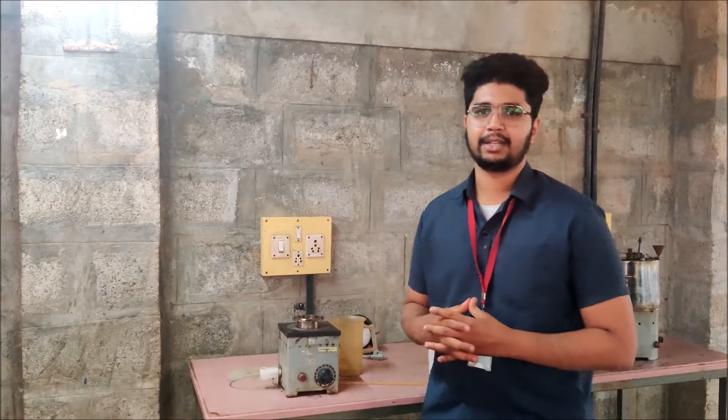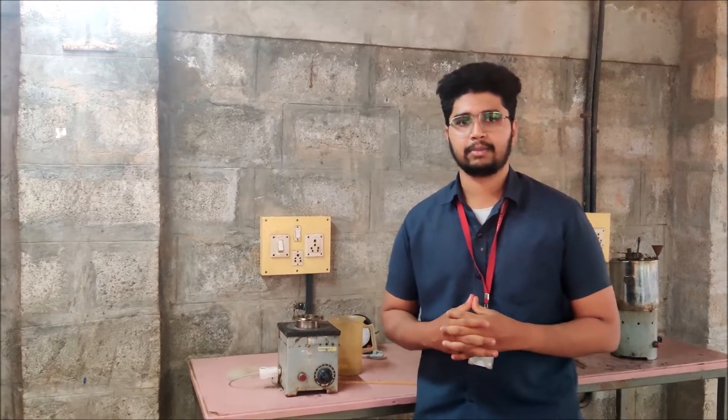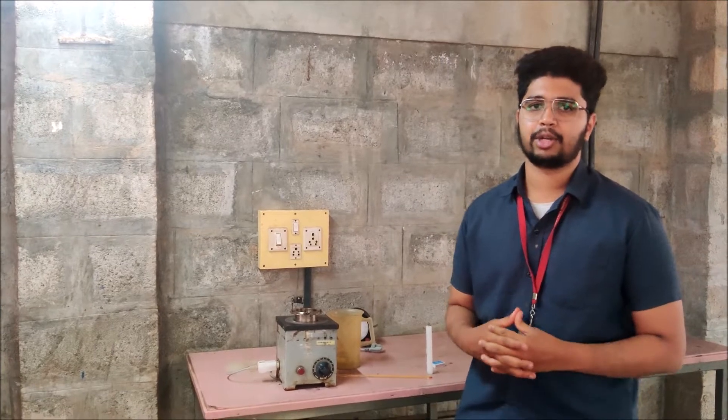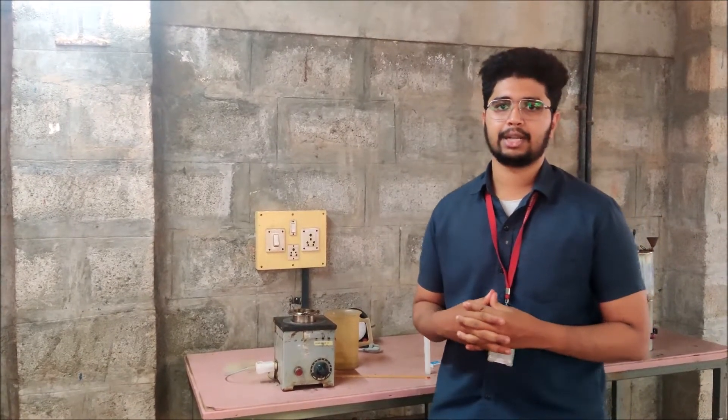Hello everyone, this is Anirudh from Sathagiri College of Engineering. I am studying in 5th semester mechanical engineering. Today I am going to show you how to determine the flash point and fire point of any given oil sample using Cleveland's apparatus.